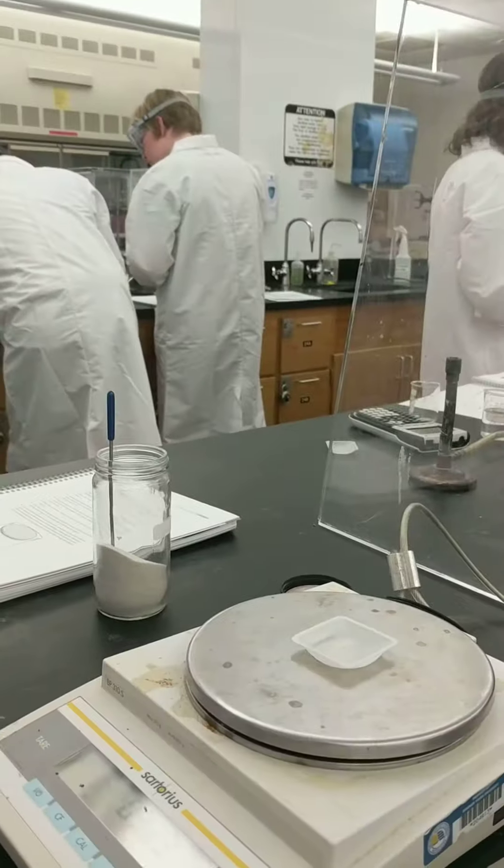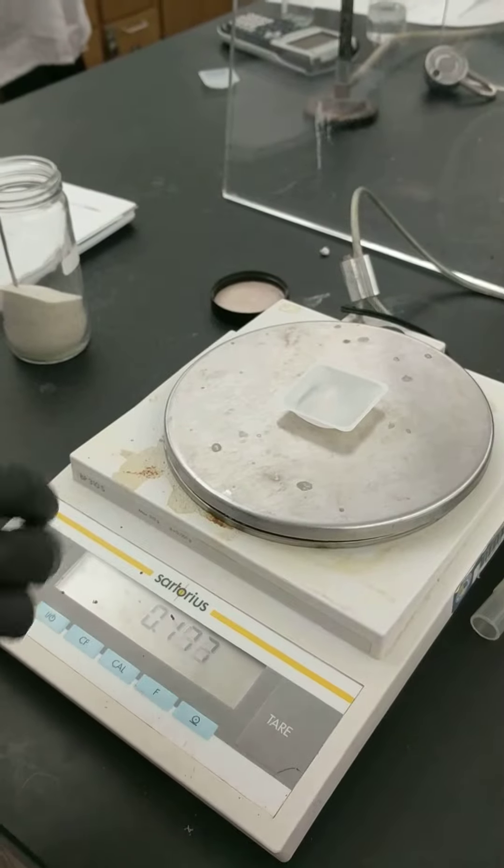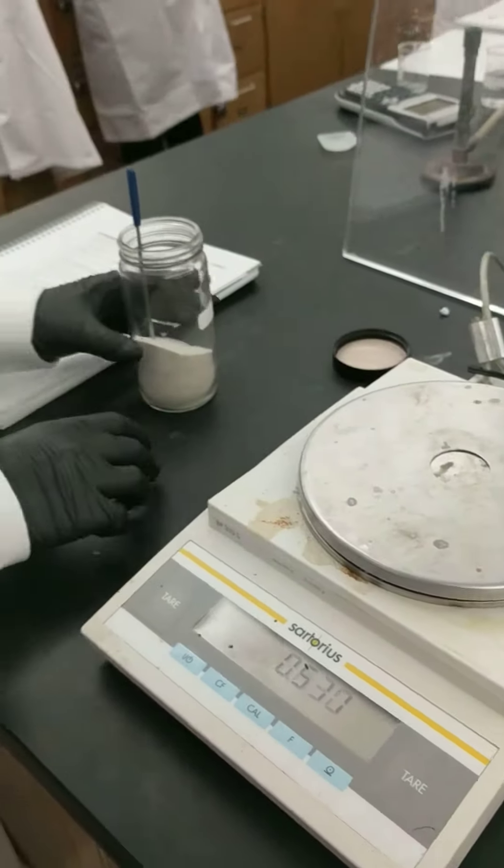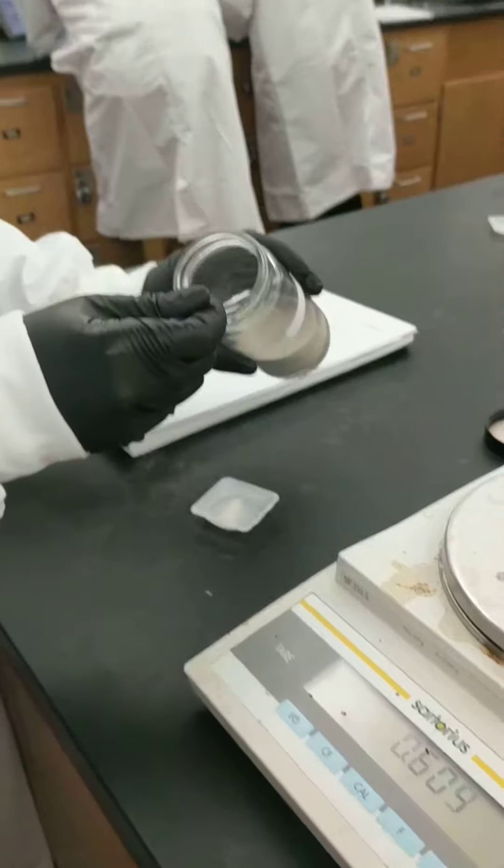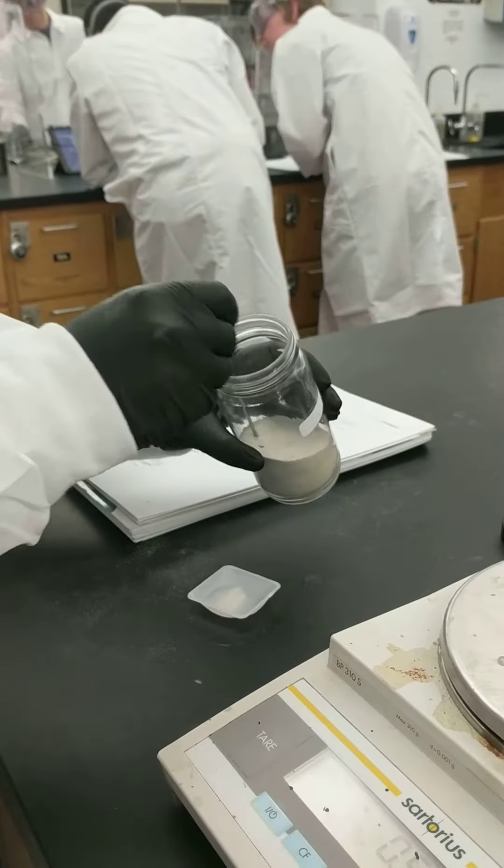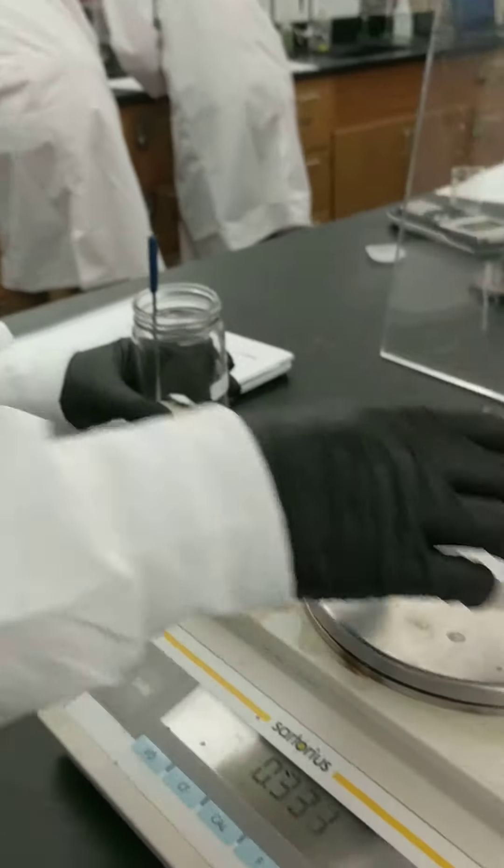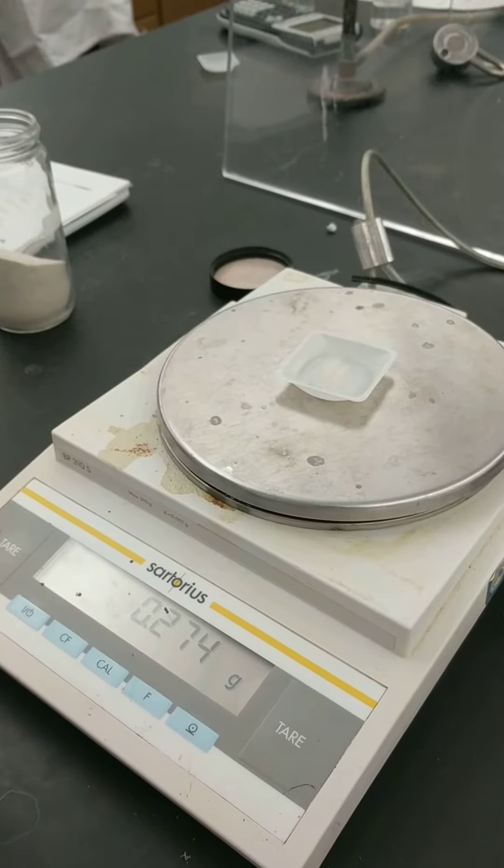So, I put it back on the scale, and it's just a little short, so I will take it off again, put some more on, put it on, and now I'm a little over.